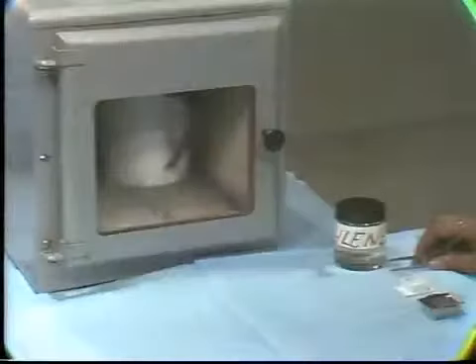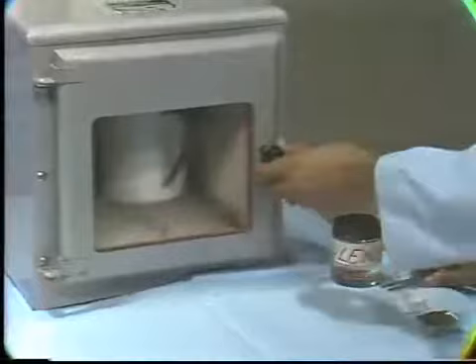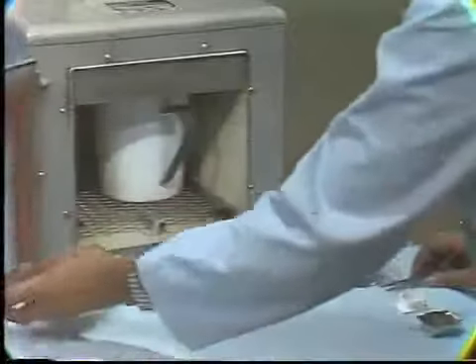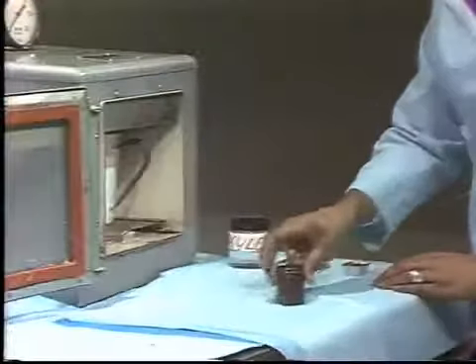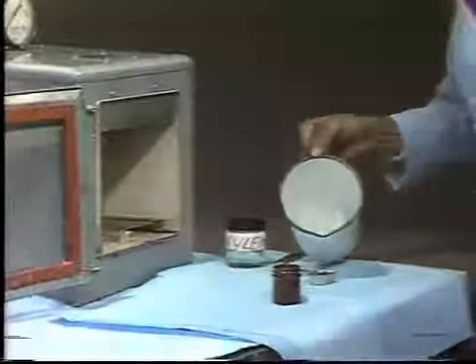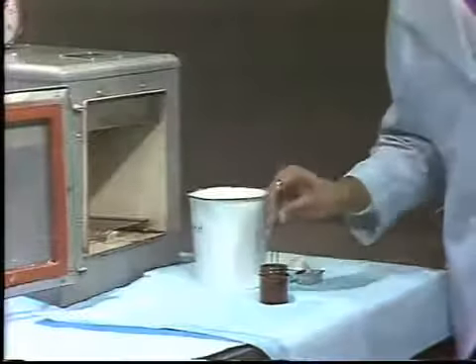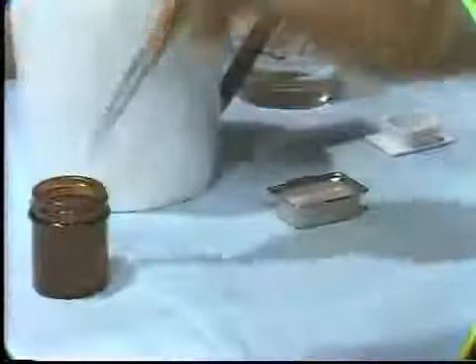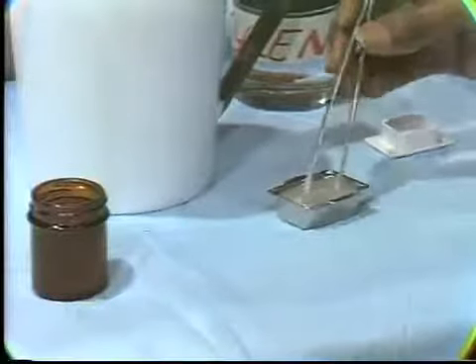Let me show you some of the equipment used for this. This is a paraffin oven, and we have the tissue now in melted paraffin, and the xylene now will be replaced by paraffin. We're going to remove this from the oven and place the tissue in a container. And it's that container that will cool. The paraffin then will solidify, and we'll have a block of paraffin with the tissue embedded in it. Later, we'll take that block and put it on the microtome and get our thin sections.